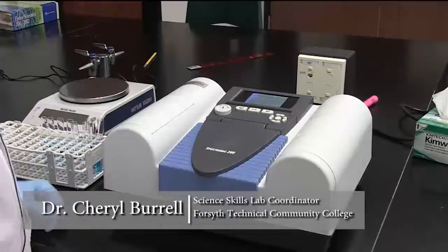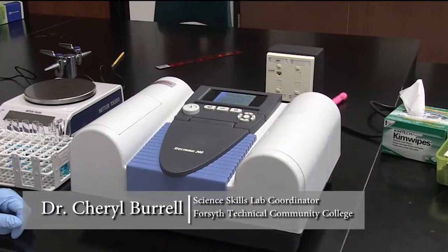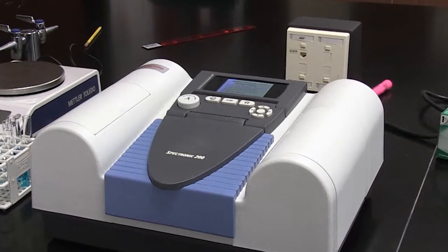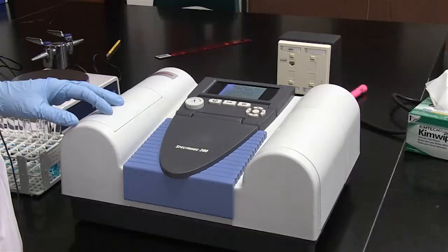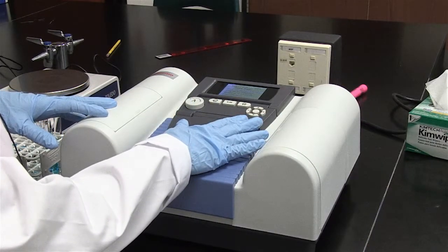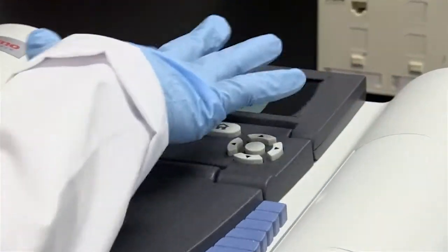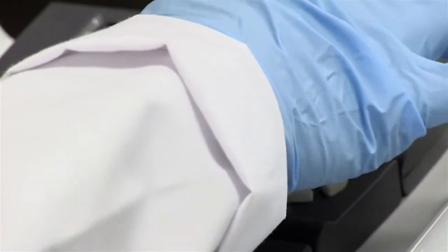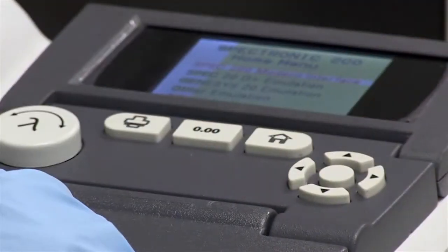This is how your spectrophotometer is going to look — the one you'll probably be using in the lab. I'm going to show you some important features and certain knobs you need to be familiar with. This is the home screen, which brings you to an interface with a series of options. We're going to use the Spec 200 Modern Interface option.